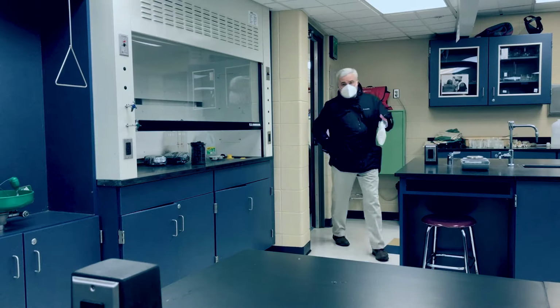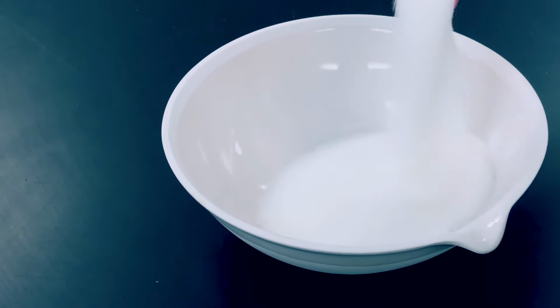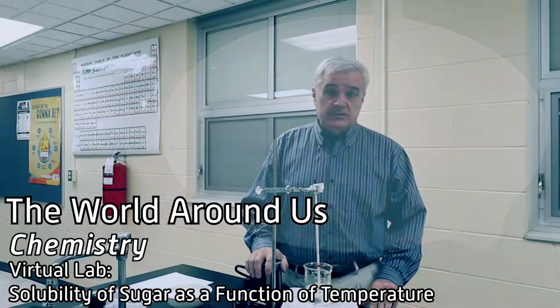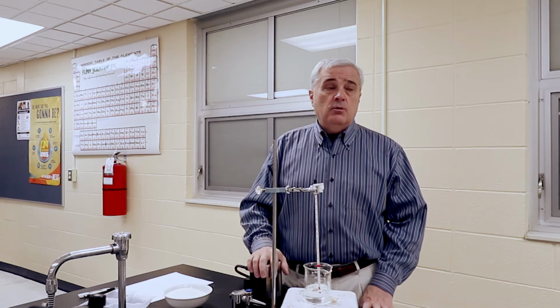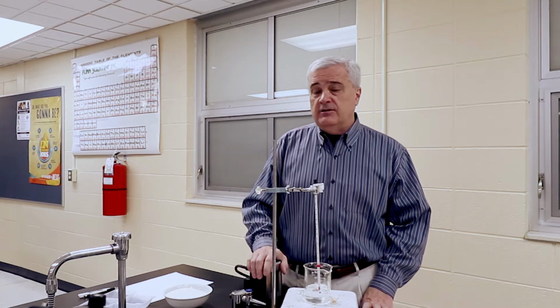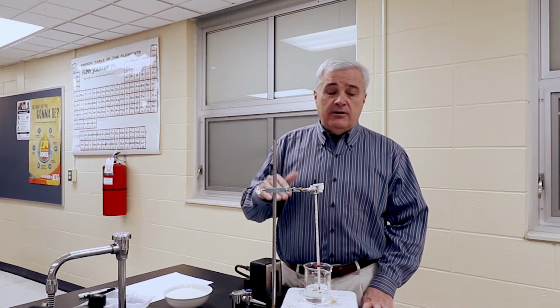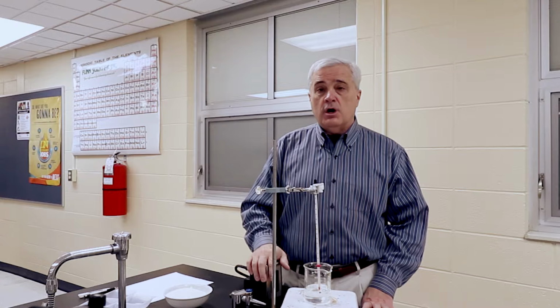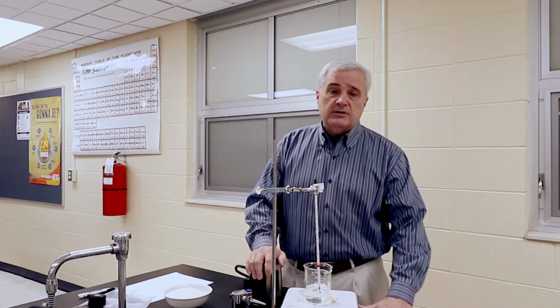In this episode, we're going to be looking at solubility as a function of temperature. We're going to be looking at the solubility of a particular substance as we dissolve it into water. We're going to be calculating the molarity of this substance and what is the maximum molarity that we can achieve at various different temperatures of water. So that is the gist of this laboratory exercise.